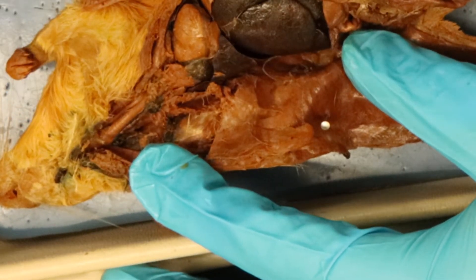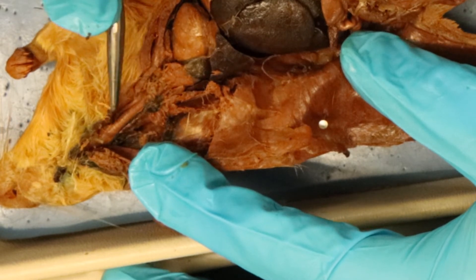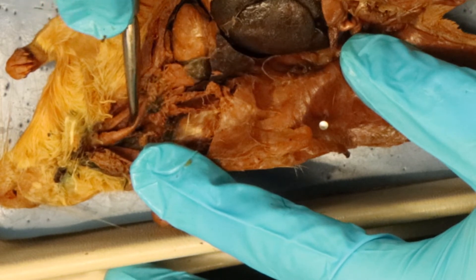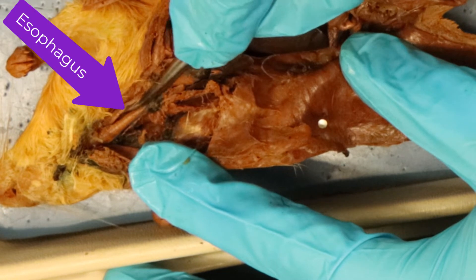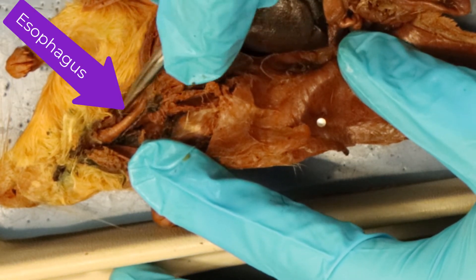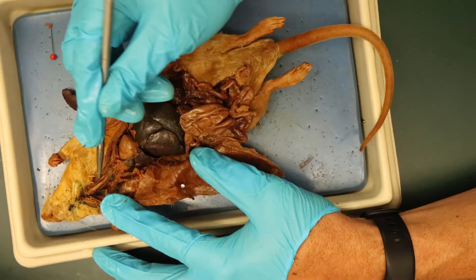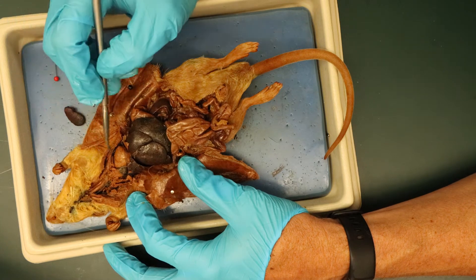Up at the top here — not on our list, but just so you notice — it's easy to see: first up by the head we have the trachea, and if I move the trachea aside, the tube underneath right here is the esophagus. The esophagus sits right behind the trachea.